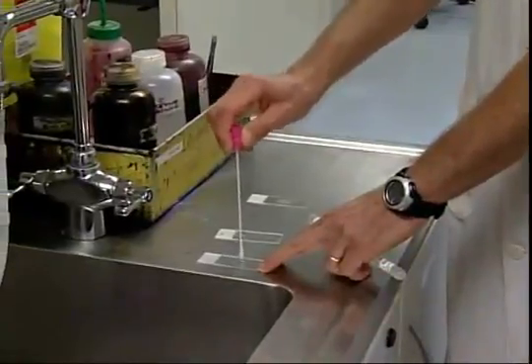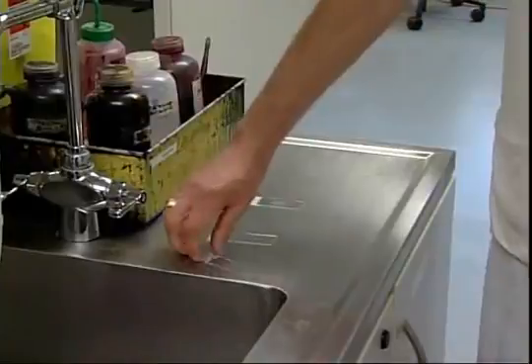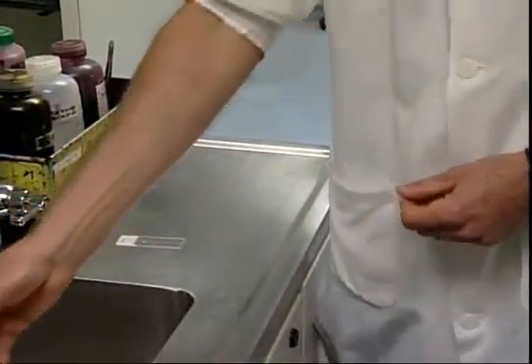Gram stains are done on either swabs or fluids. A swab might be from a surgical patient that you've taken on the floor, and a fluid might be, say, a spinal fluid. With swabs, after we've cultured it, because you don't want to contaminate the plates, we just dab it onto the slide like this. Then we heat fix it till it's dry, and then it's ready for staining.